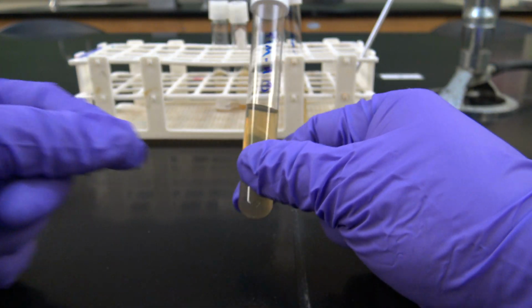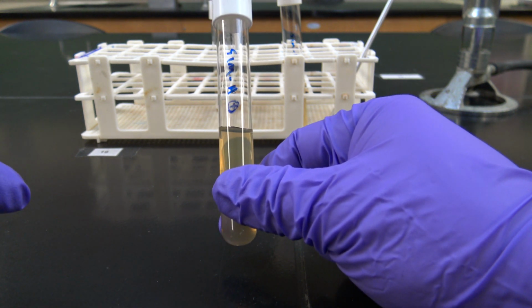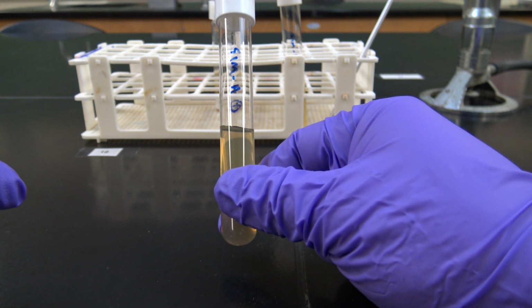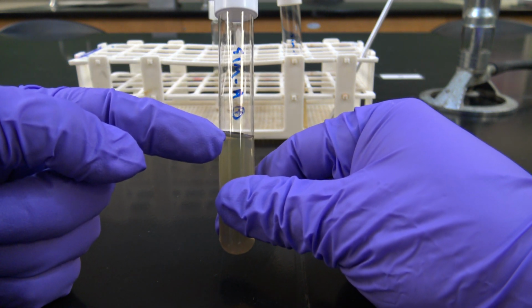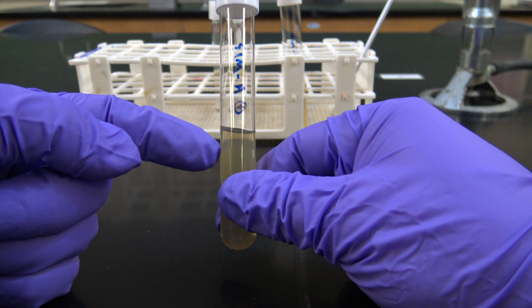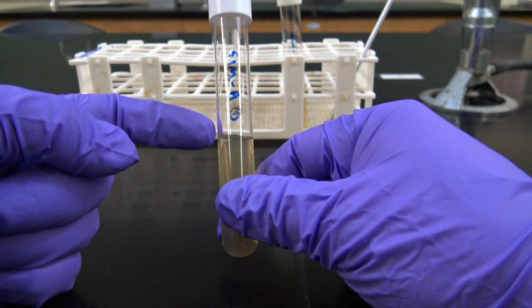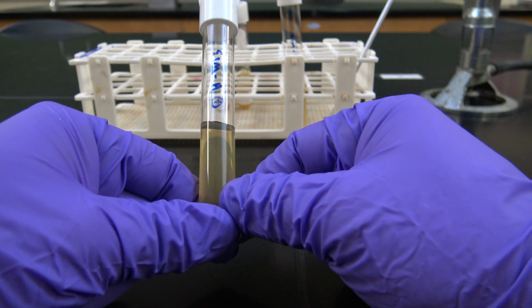This test has two parts. After the initial inoculation, we let it grow, but then we check for the presence of indole by using a prepared reagent that we drip on top of the media, and if there's a color change, we can determine if it's positive or negative for that test. So that'll come when we check the results of these.